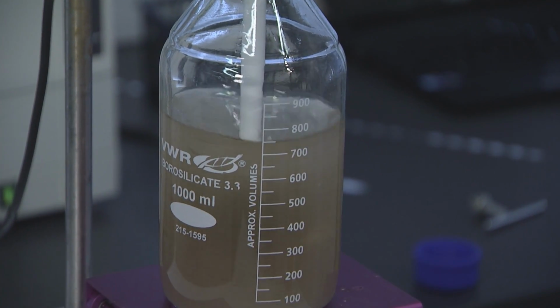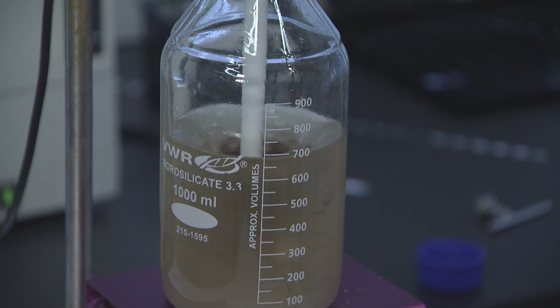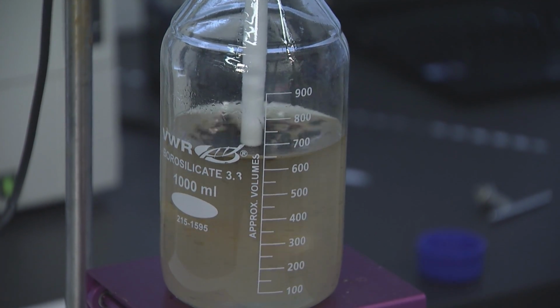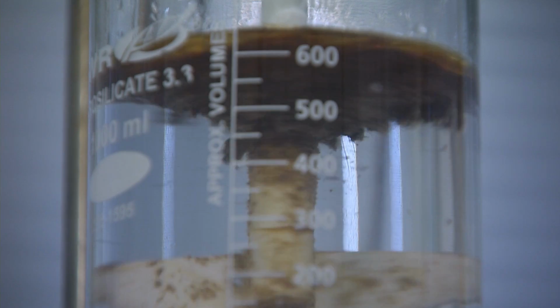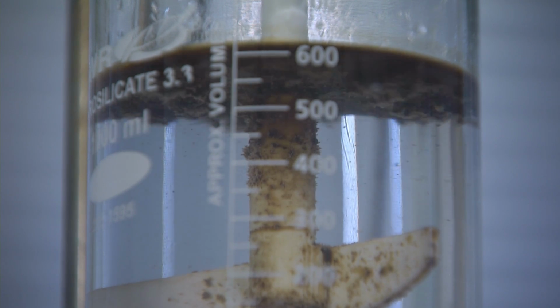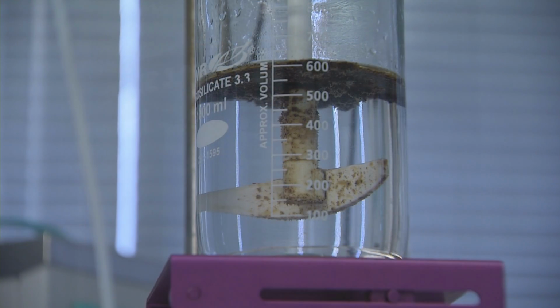After activation, flocculation is immediate, meaning that in continuous processes, this can be conducted in-line, upstream of separation devices. No reaction or flocculation vessels are required. The time taken here to achieve clear solution is not so much due to the flocculation process itself, but more the time for the physical separation, here based on gravity alone.